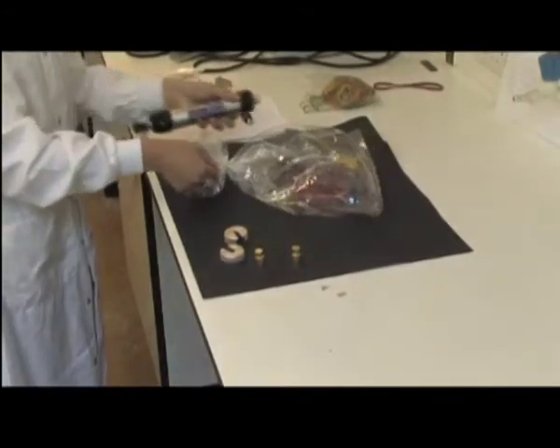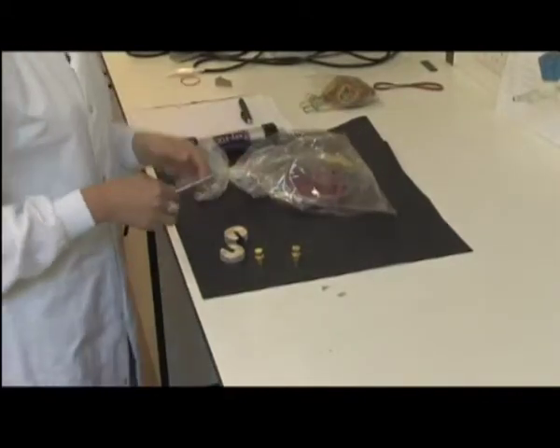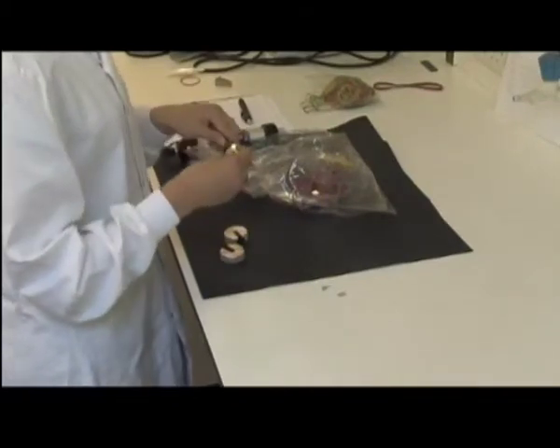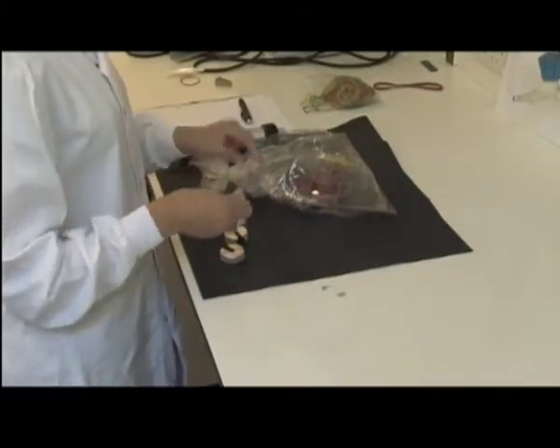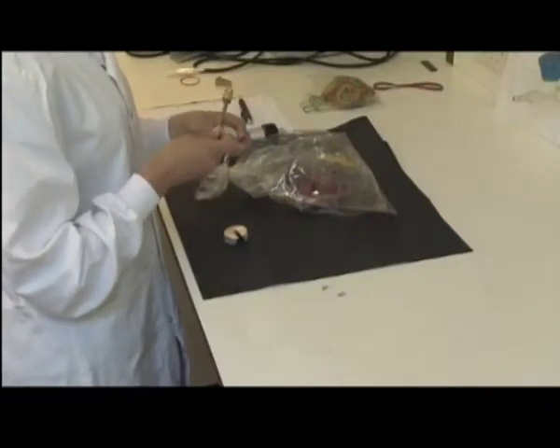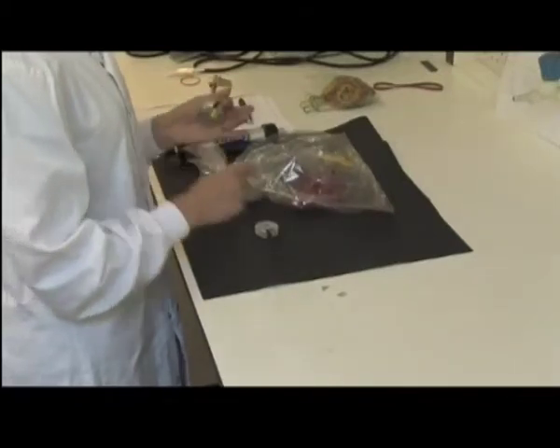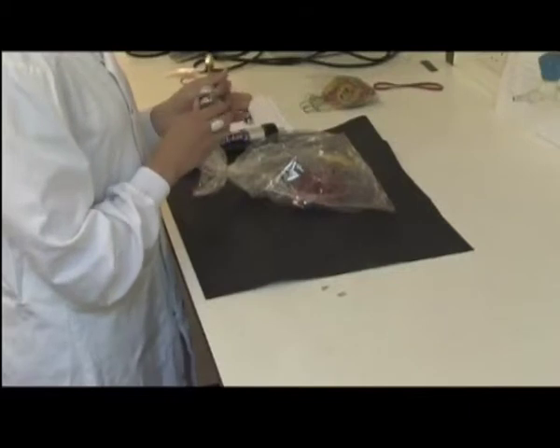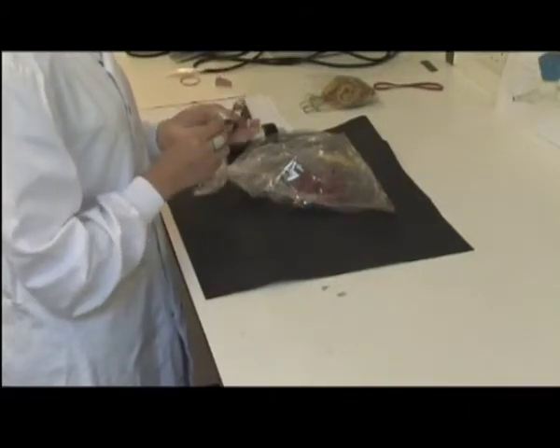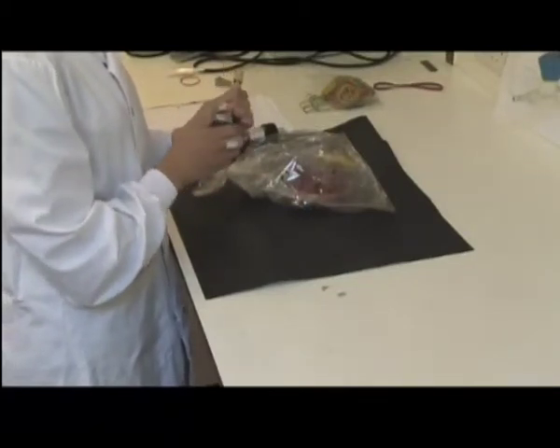Disconnect the pump from the tube and pull the tube out of the bag. Re-seal the tube on both ends by sliding the cap onto the tube and sealing it finger tight. Then seal with the tool, turning the nut and cap a quarter turn clockwise against each other.